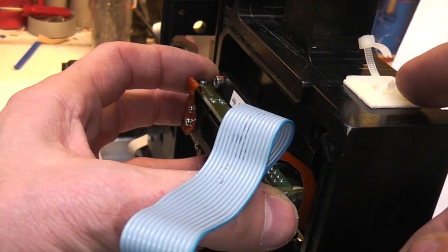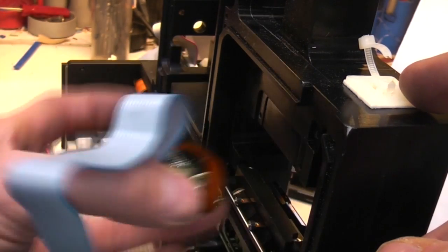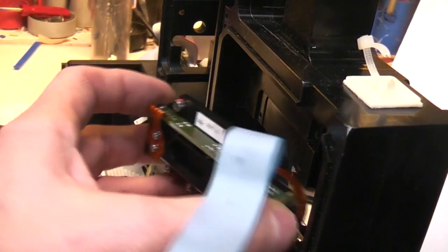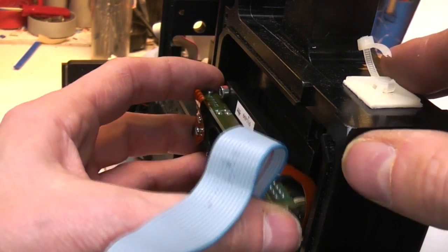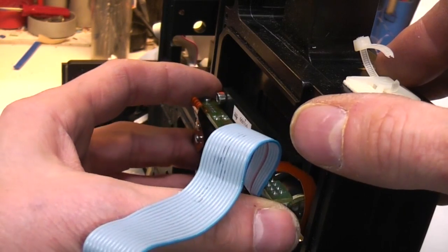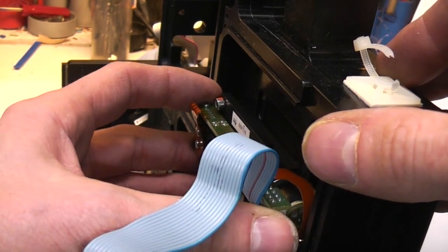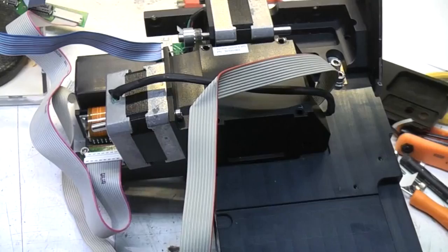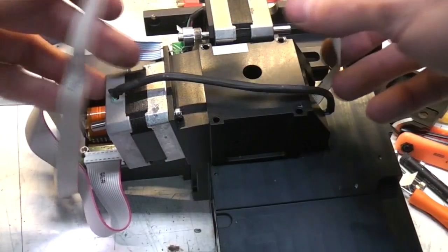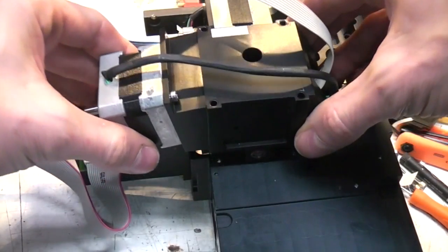Again, I don't know too much about what the actual requirements are for this, but you've got these various options. By adjusting these slits you can measure various things. I mean, you could probably modify this quite easily to make quite a nice spectrometer. I suppose if I've got nothing better to do, I might have a go at some point. Right, now moving down to below the Acousto-optic beam splitter. I've got these two big stepper motors.